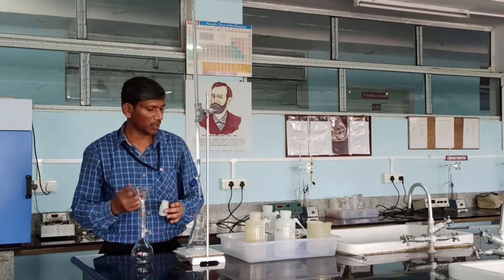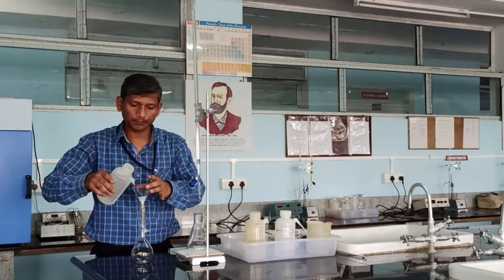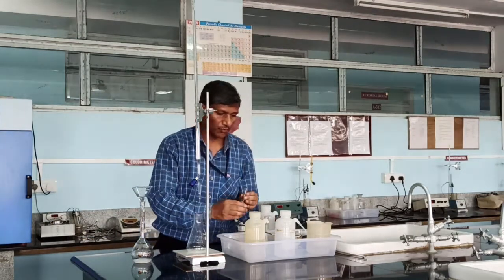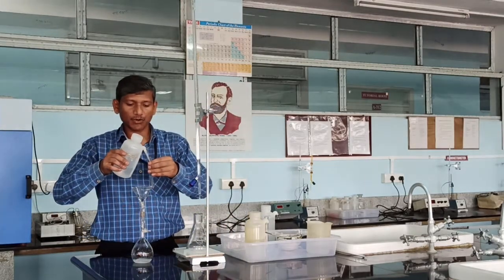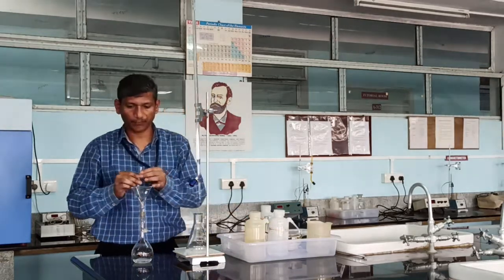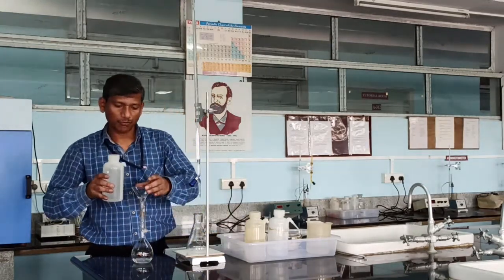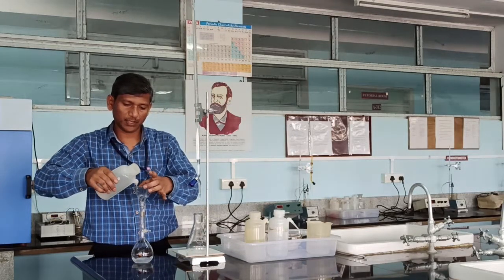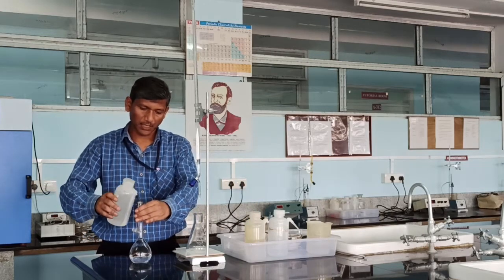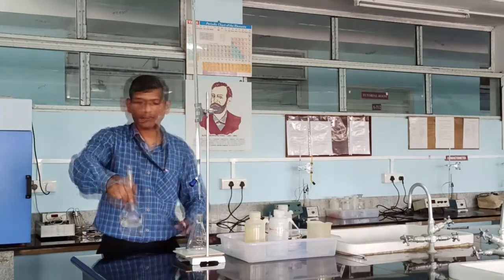Weigh the bottle before and after taking the salt; the difference gives the weight of salt taken. Then add water and one test-tube full of ammonia solution. The reason for adding ammonia solution is to increase the rate of dissolution of the salt. Now wash the funnel and wash the sides of the flask to dissolve the salt completely.